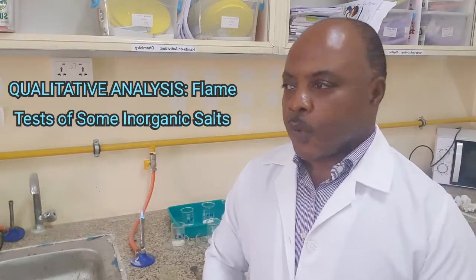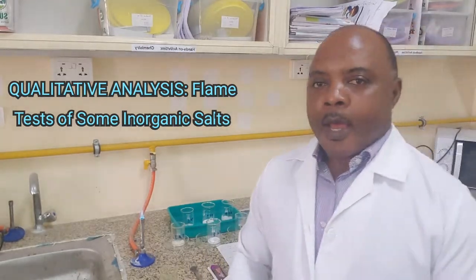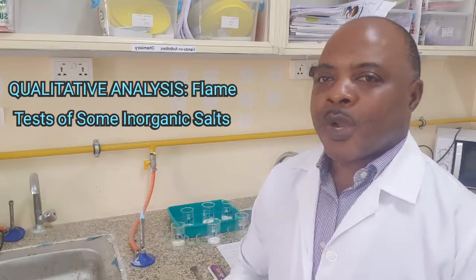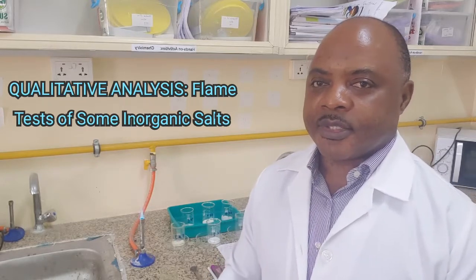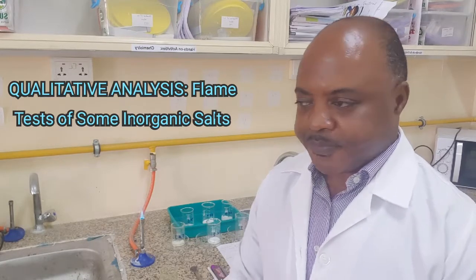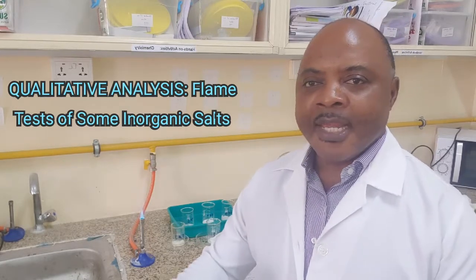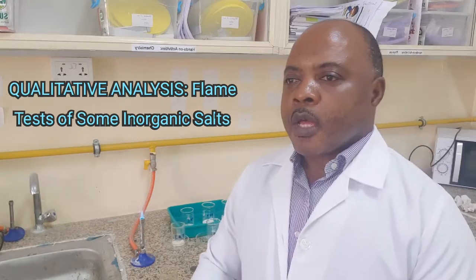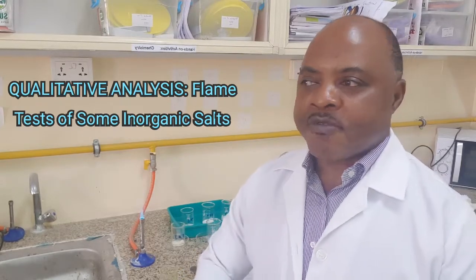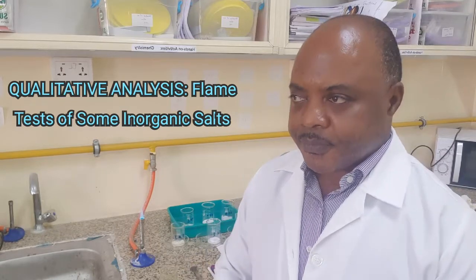In this video, I am going to show you how you can determine cations in unknown salts that you are provided. Specifically, during practical exams, students are provided with unknown salts.